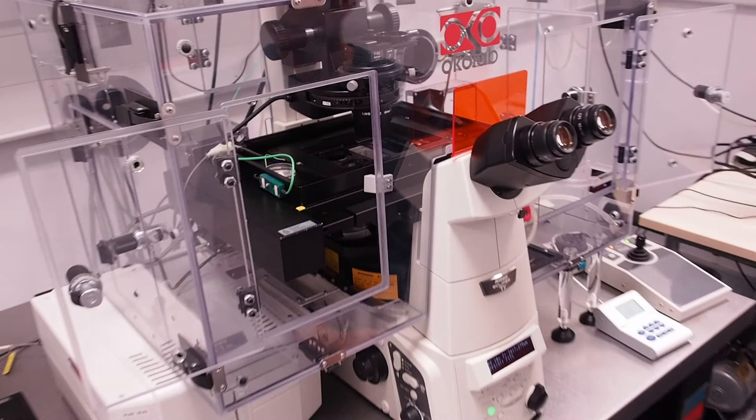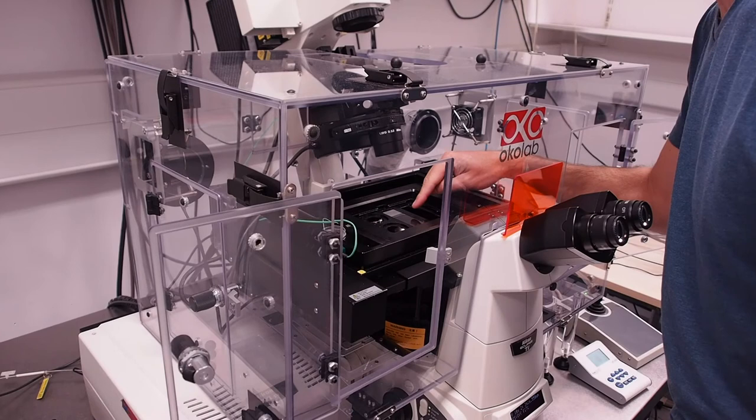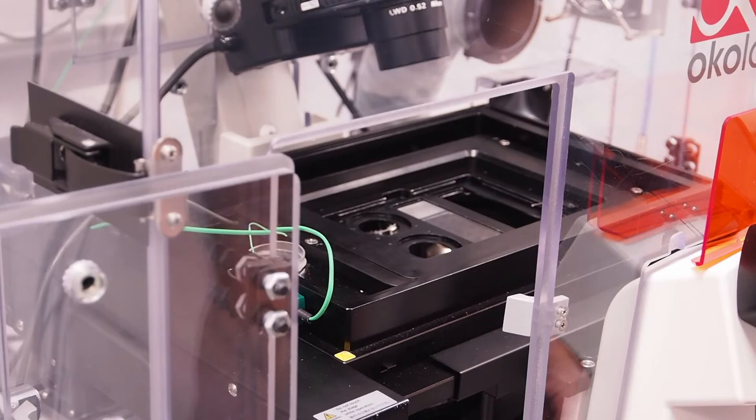If you wish to use an oil immersion lens firstly check that the current position means the lens isn't close to the edge of the sample holder otherwise the oil immersion lens won't be able to reach the focal plane. Do this by tilting the condenser arm back and checking the current position.